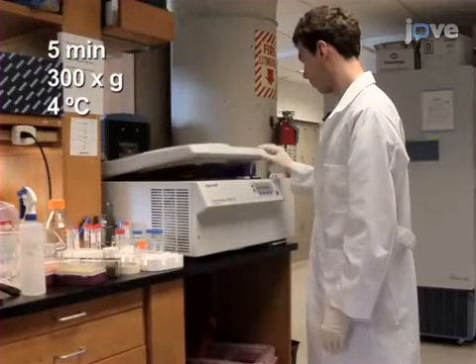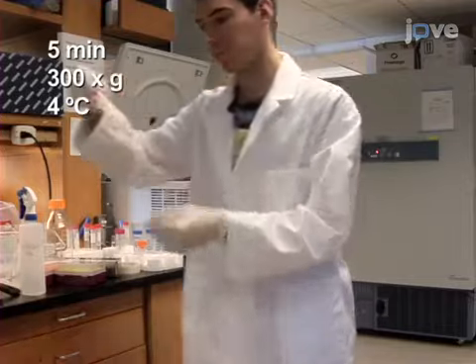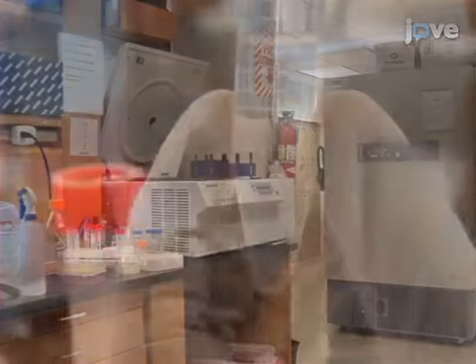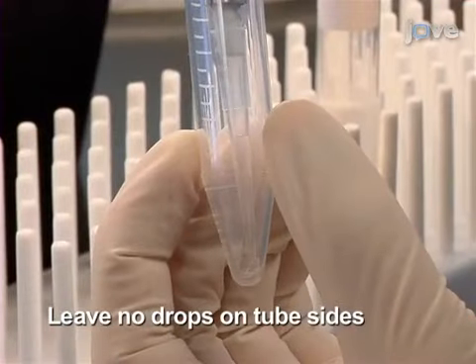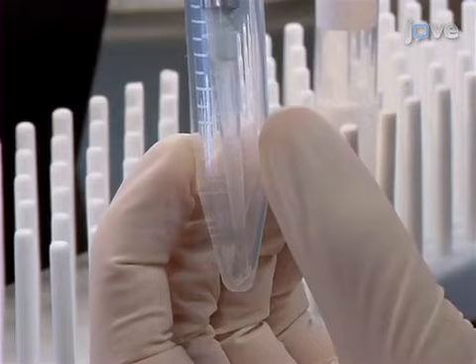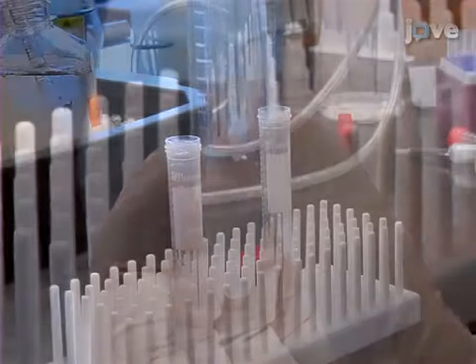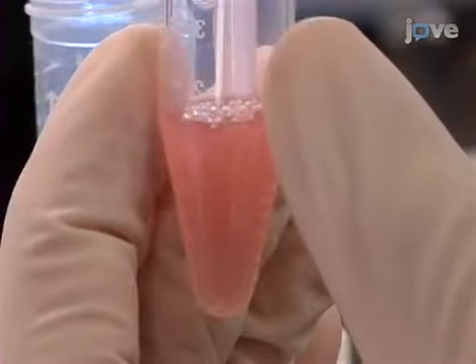After spinning down both the tube containing the eluted bound fraction and the tube containing the flow-through unbound fraction, carefully aspirate the supernatant from the bound fraction and resuspend the cell pellet in sorter buffer to a final volume of exactly 95 microliters. Aspirate and resuspend the unbound fraction to a final volume of 2 milliliters.